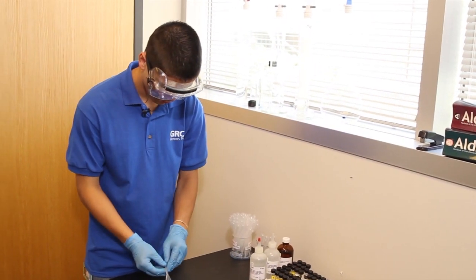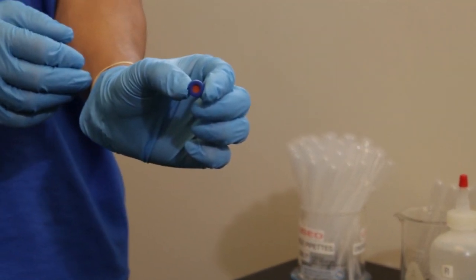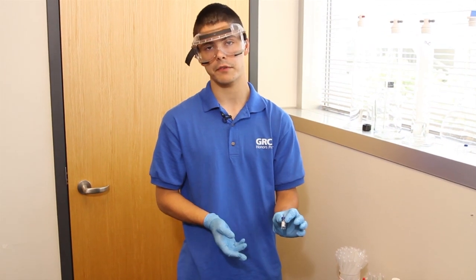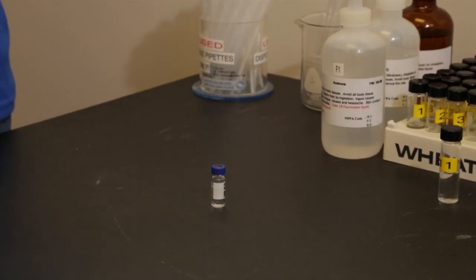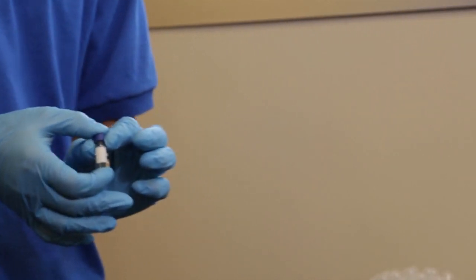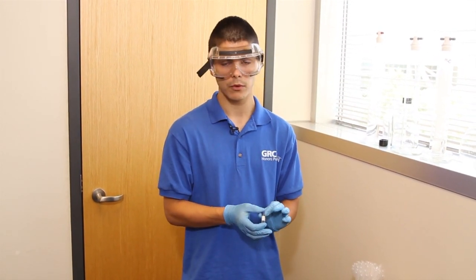Now I'm going to put a cap on the vial. These caps are a little special — they have a part in the center that allows a syringe to go through while still having the cap on. This helps in multiple ways: you don't have a chance of spilling your sample, and if you have something potentially dangerous where the fumes could be dangerous, you want to make sure it's closed — especially if you have volatile solutions. Now that I've made my sample, I'll show you how to inject the sample into the GC MassSpec, then how to analyze and interpret the data to figure out what our unknown is.